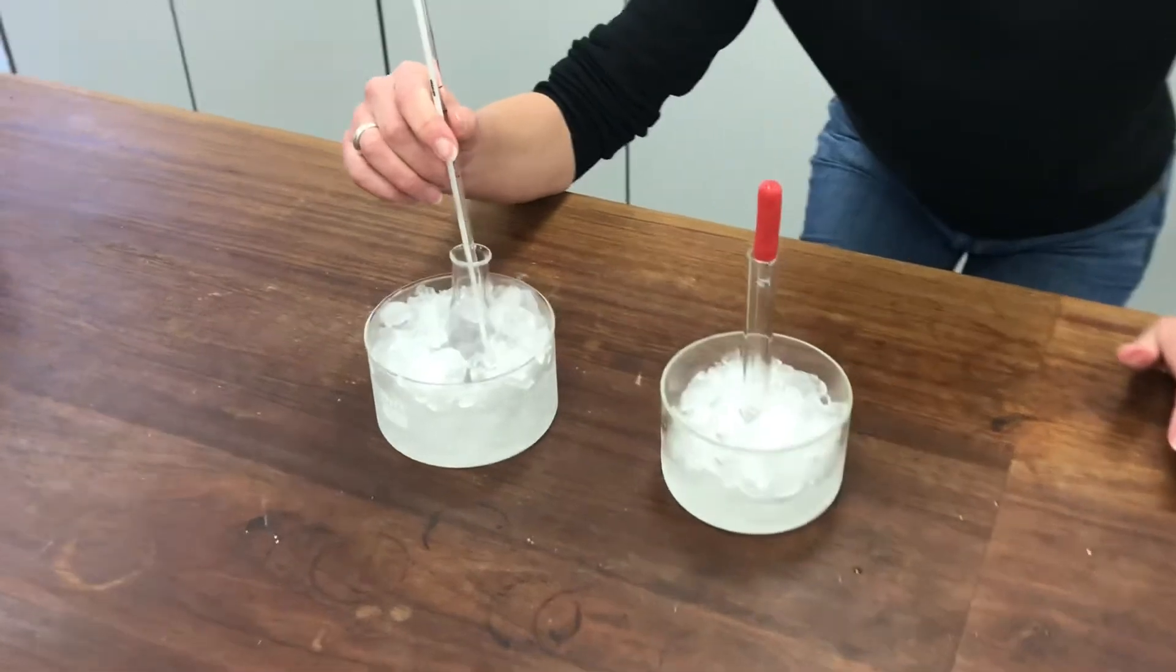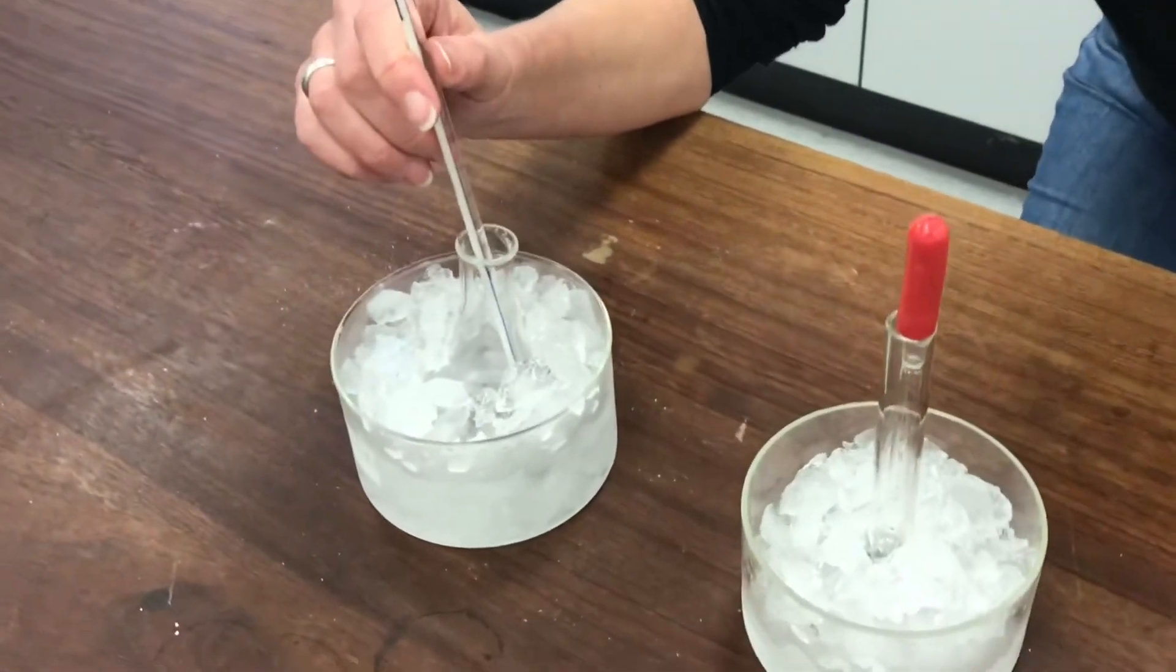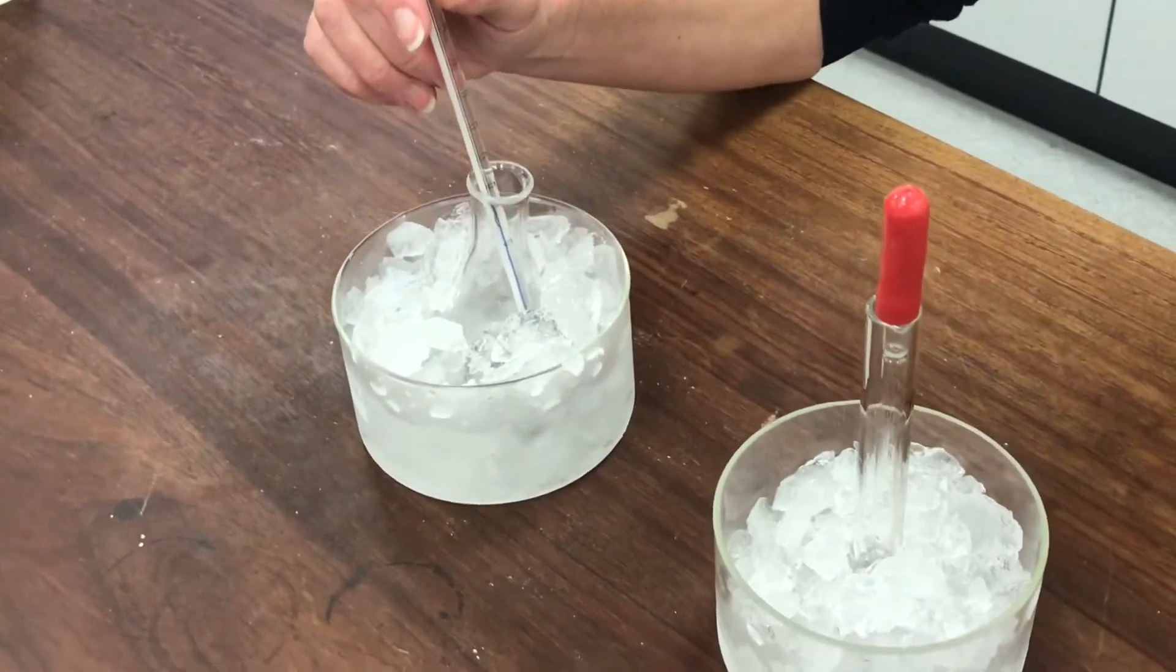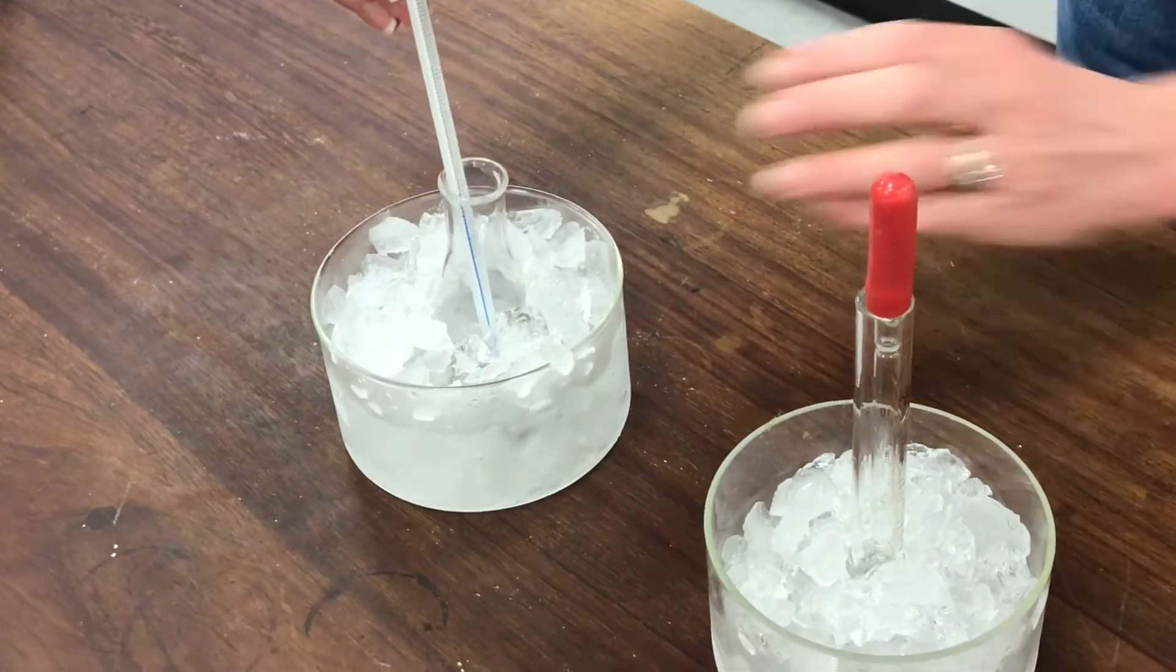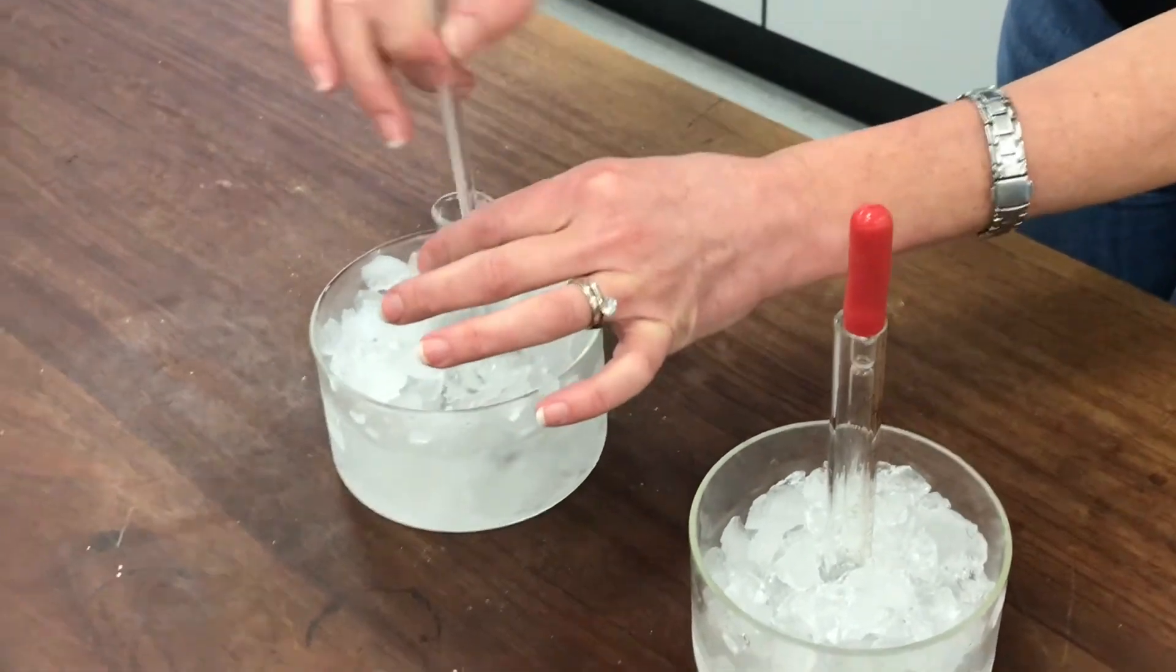So I think I added about 4 drops in. I was quite hasty. And it's already gone up from 4 degrees C to 7 degrees C so you can see that I need to be really cautious with this.